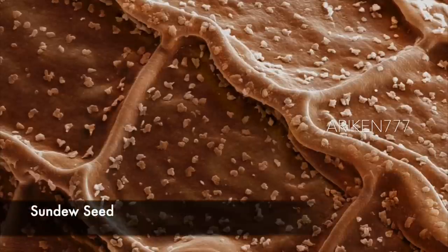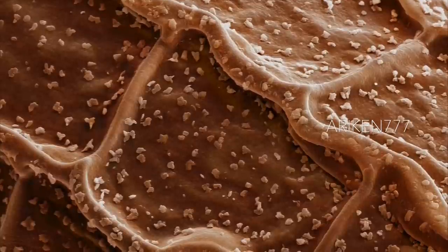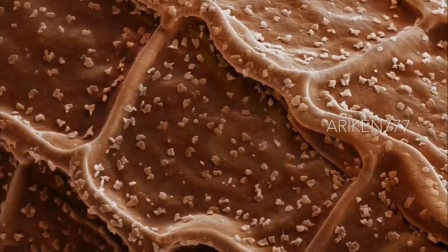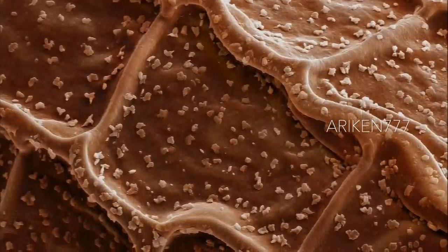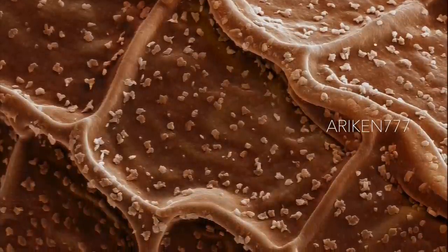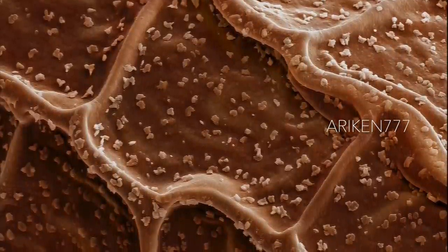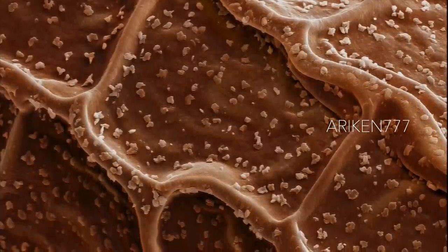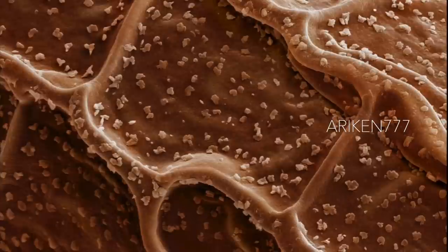The surface of a Cape sundew seed. This carnivorous plant comes from the Cape region of South Africa and thrives in bogs, marshes, and wet grassland. In the spring, it grows a long leafless stalk which produces pretty five-petaled pink flowers which open one by one up to the tip of the stalk. Unlike the British species, it is not dormant during the winter. Sundews secrete a sticky substance on the trichomes or hairs on their leaves. An insect is lured onto the dew-like liquid and when it struggles, more sticky hairs will touch its body and it will become more entrapped. The leaf curls around the insect and slowly the plant's digestive enzymes will break down the soft parts of the insect's body. The leaf will then uncurl and the husk of the insect will be blown away.